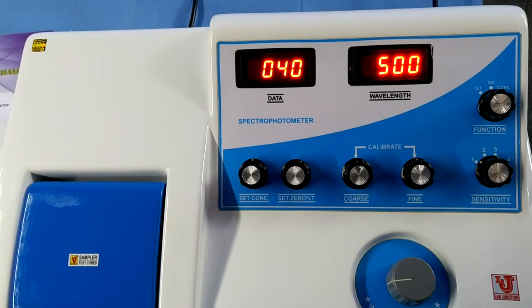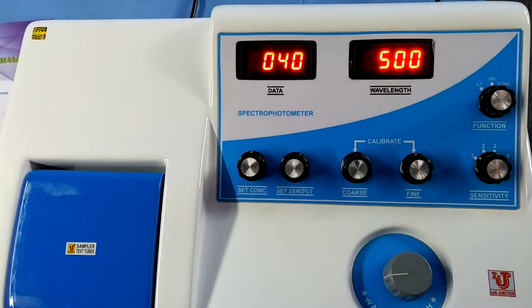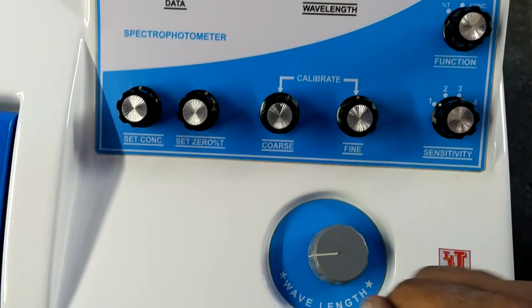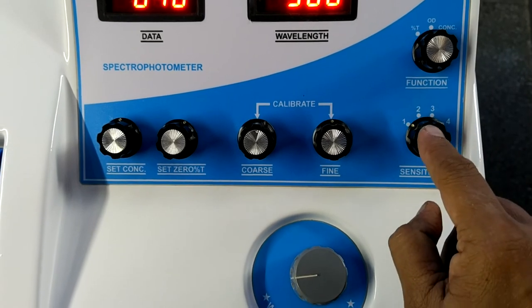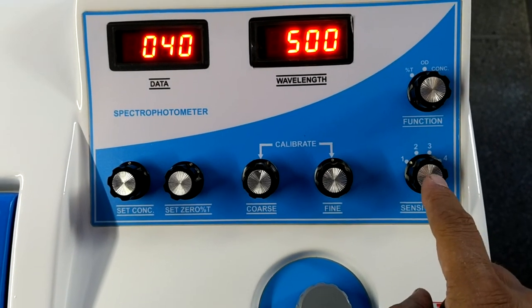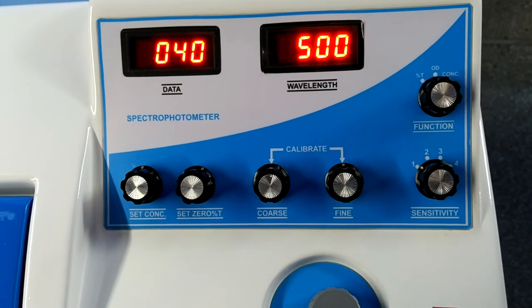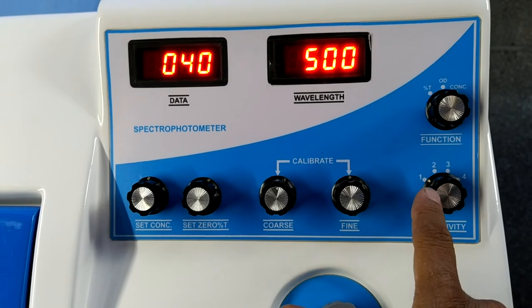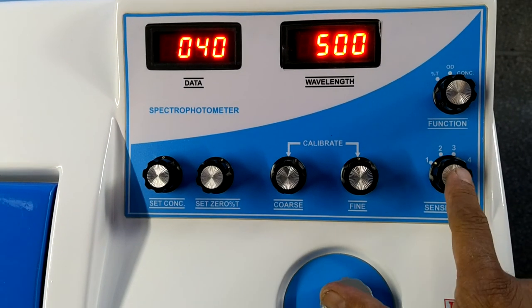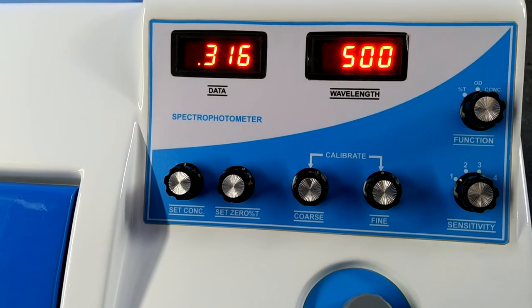Now replace it with your sample and the spectrophotometer automatically shows your concentration of unknown samples. If you don't achieve 40 PPM on sensitivity 1, then raise the sensitivity to the second position. If you don't achieve on 2, raise to 3. Always use minimum sensitivity. Thanks.